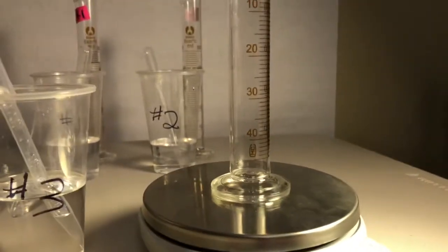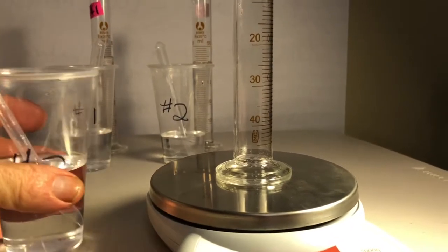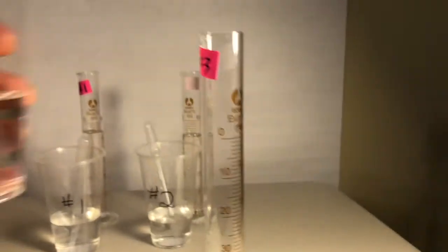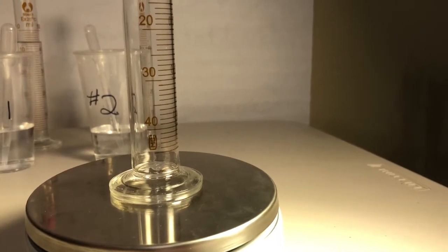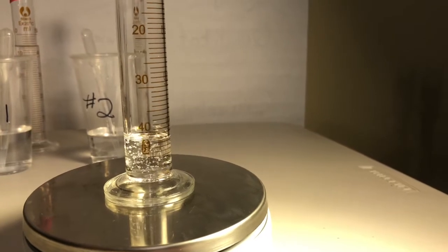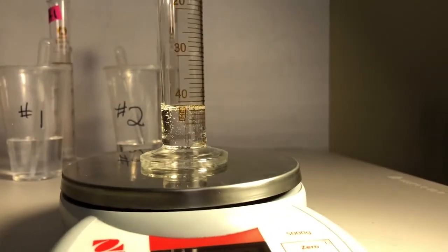All right. Now, can I do squishy squishes with these? I think I can. I'm going to pour it first, though. All right, here we go. Scale says 0. Here comes data set, or liquid number 3. Beautiful, clear liquid number 3. Point number 1. What is going on with that crazy stuff? Let's zoom in a little.